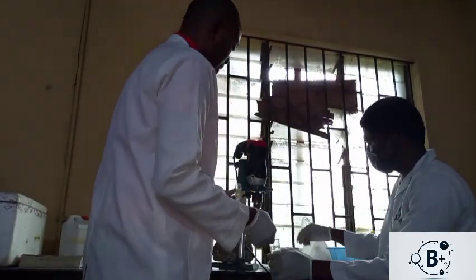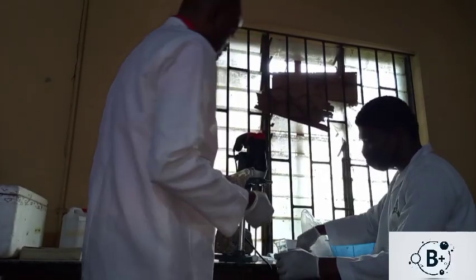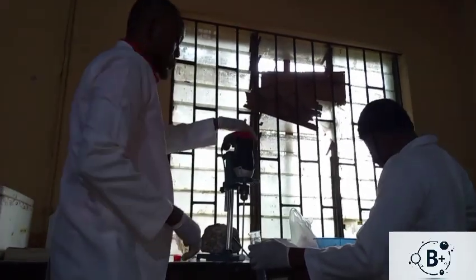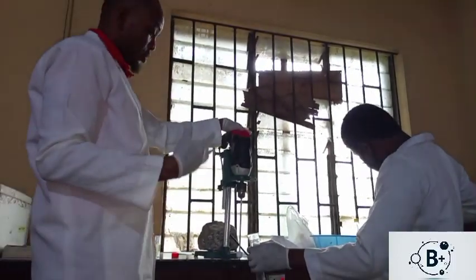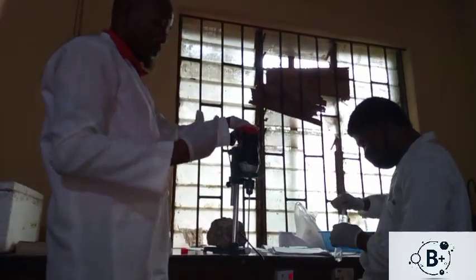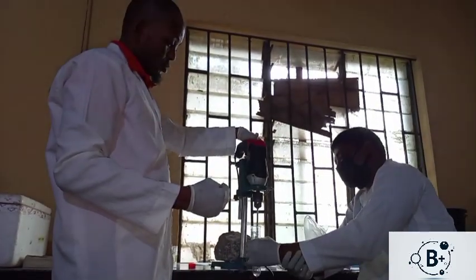So this is 6LLT. So each tissue has been coded to symbolize their group, the group of the animal model where the tissue has been gotten from, and the markings on the animal.